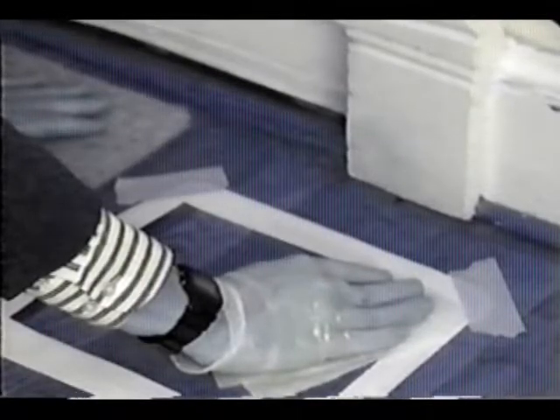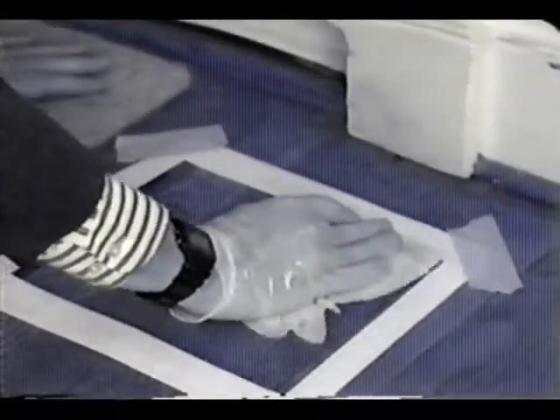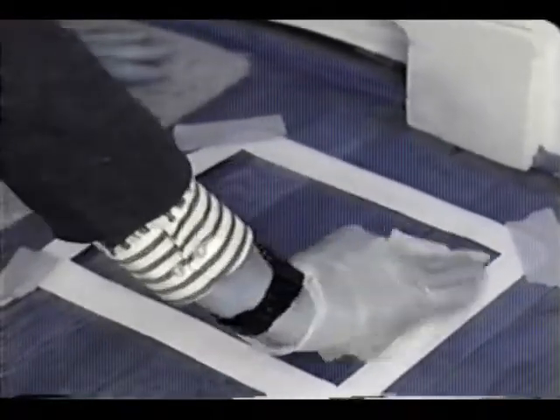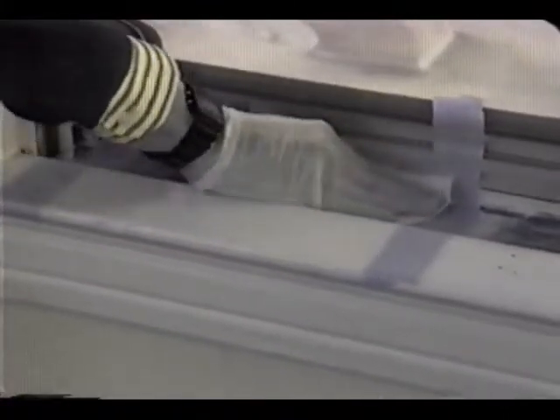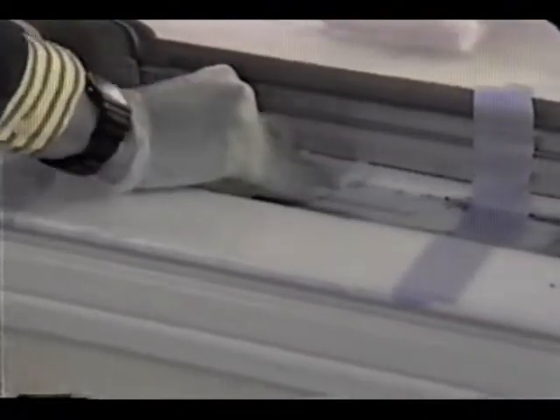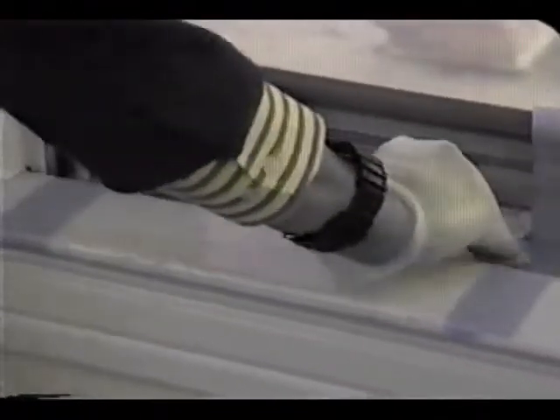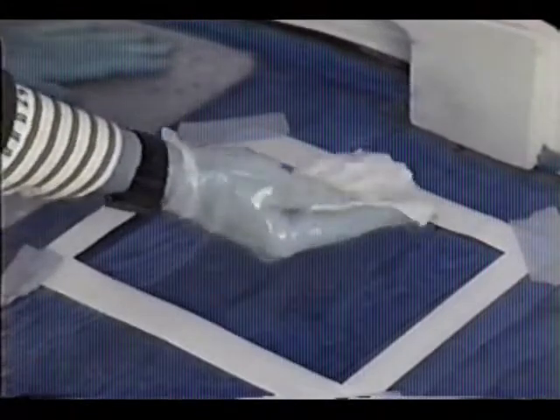Place it flat on one corner of the wipe area and wipe the entire surface from side to side with S-like motions. Do not leave the boundaries of the tape or template. Be firm but gentle. Too much pressure will cause the wipe to curl. Too little pressure will result in poor dust collection. Use as many S motions as you need to fully cover the area. Your second pass will be in S-like motions from top to bottom.